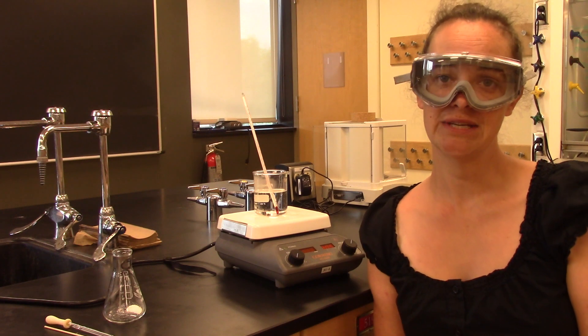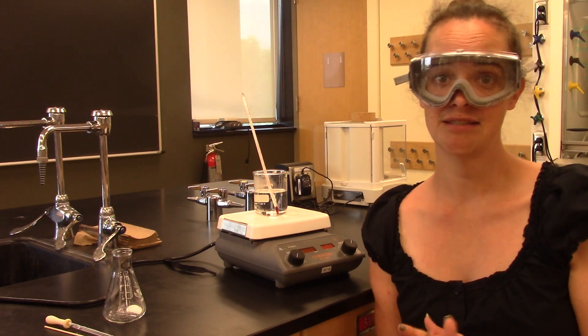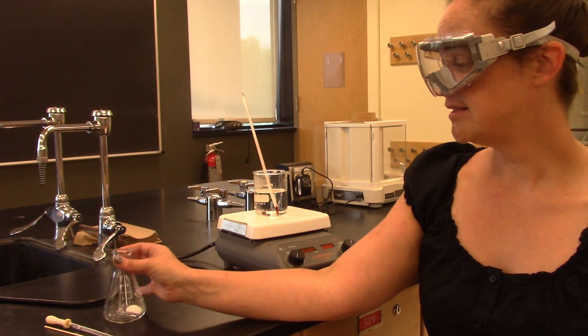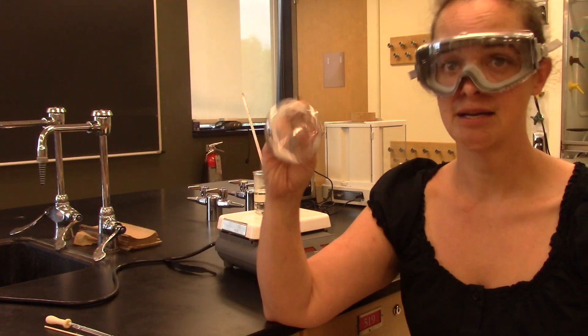Hi everyone. Today what we're going to be doing in lab is recrystallizing some compounds that have impurities in them. And so today what I'm going to do is recrystallize a sample of phthalic acid.